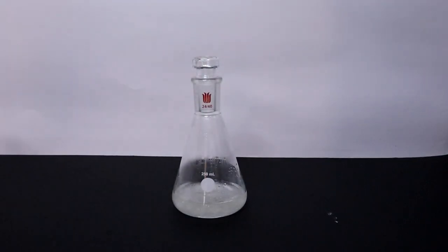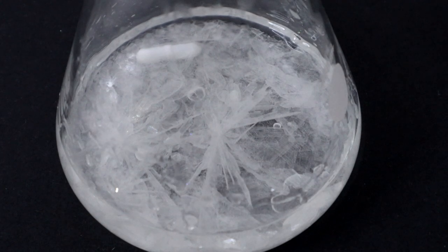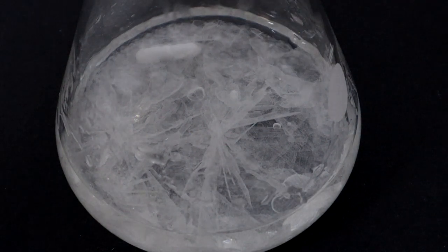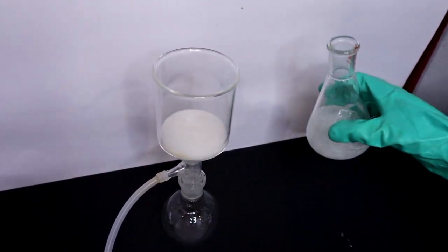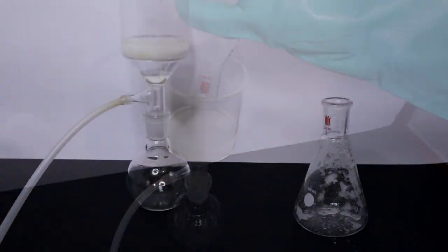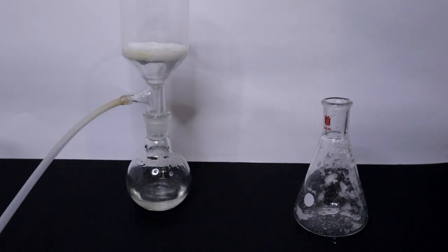The reaction vessel was then cooled in the freezer and solid plates of hydroxylamine hydrochloride formed. These crystals were then vacuum suctioned.